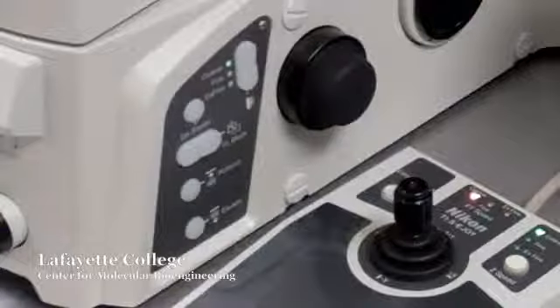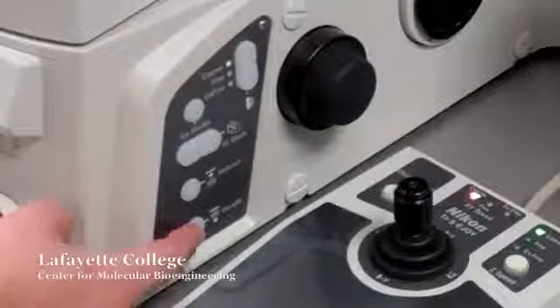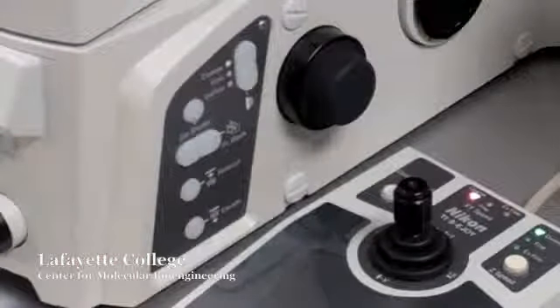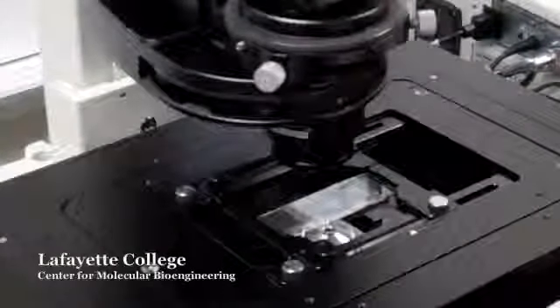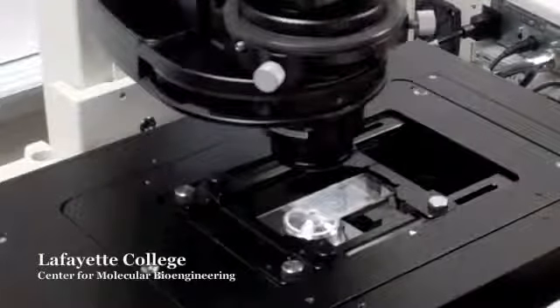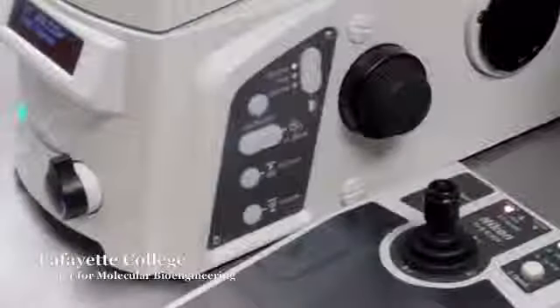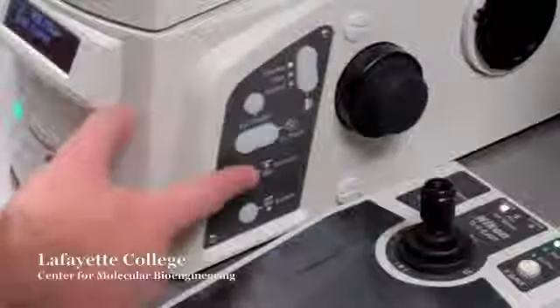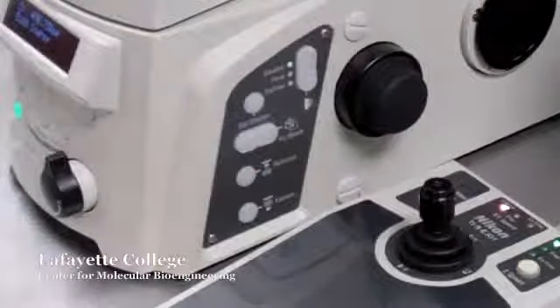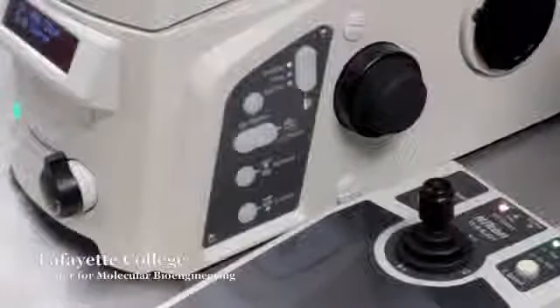To change between 10x, 20x, and 60x objectives, first press Escape to lower the nosepiece. You can manually select your objective by using the rotator beneath the stage. If using the 60x objective, be sure to add a small drop of oil to the objective's nosepiece before refocusing. Once you have finished selecting your objective, press Refocus on the right side of the microscope to raise the nosepiece back to the desired location.